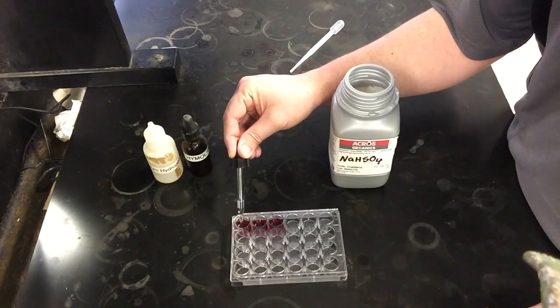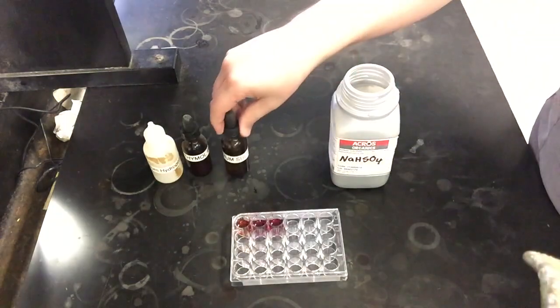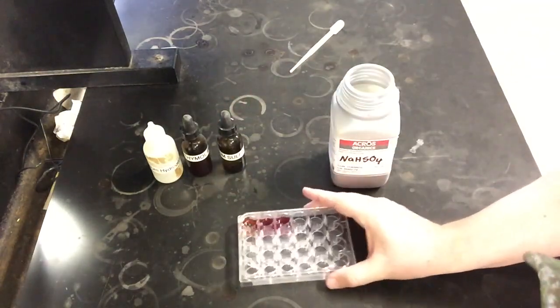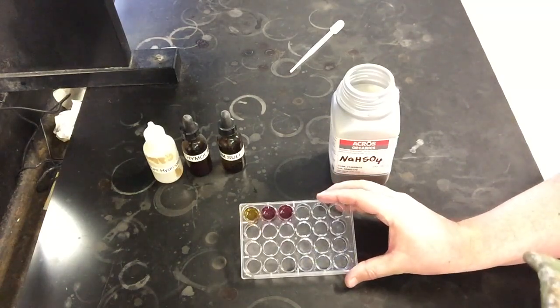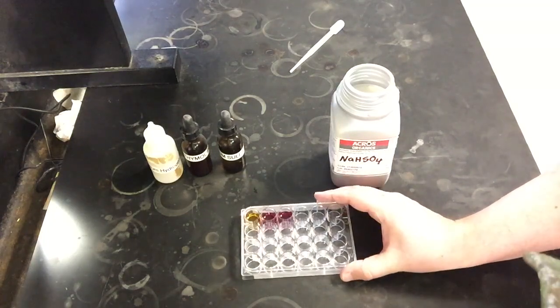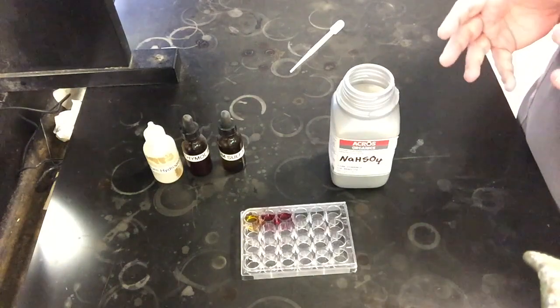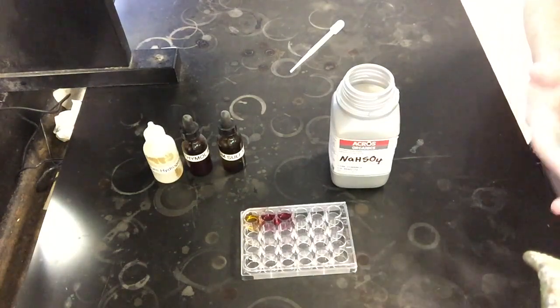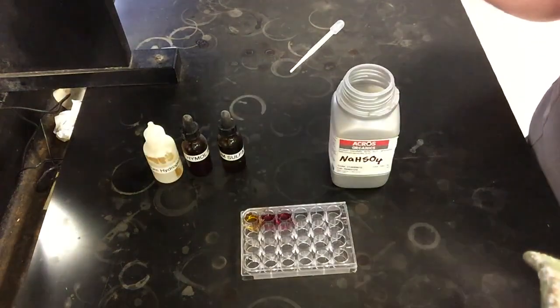So I'm going to add a few drops of this, and right away you can already see its color starting to change a little bit. I'll stir this a little bit and then try to get a good angle that the camera can see. But as I mix this up and stir this and now look at it, this solution over here has now gone almost completely yellow. Right? So adding the sodium sulfate, it's gone a yellow color. We said the yellow color is more indicative of our reactant side of the reaction. So by adding a product, our reaction has gone backwards. That's the change that we've seen.